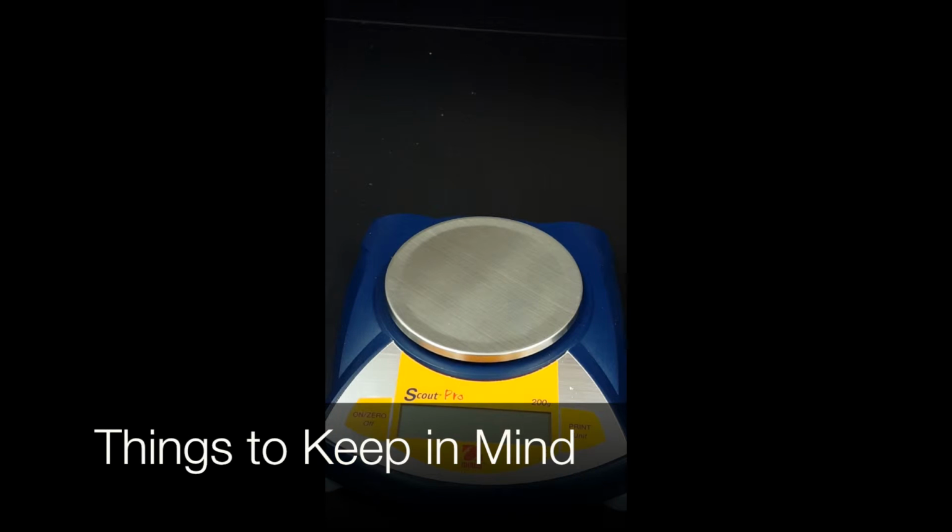Remember not to put any chemicals directly on the plate without either a plastic weight boat or glassware underneath it. Also, if the balance doesn't work properly, don't try to fix it yourself. Contact your instructor and let him or her handle it.